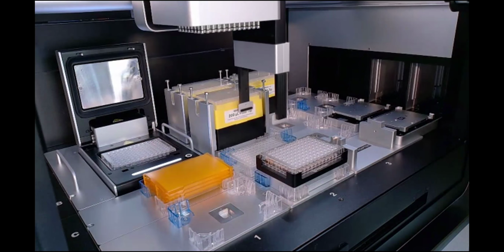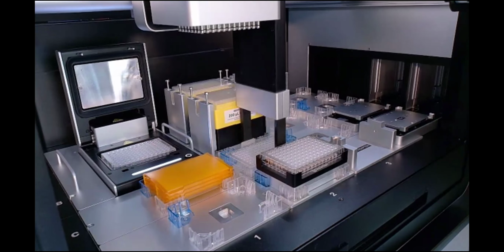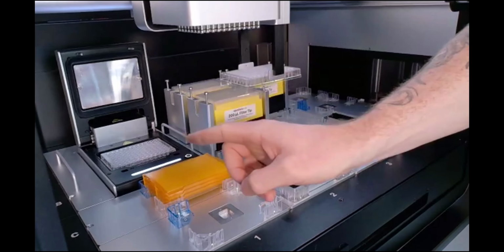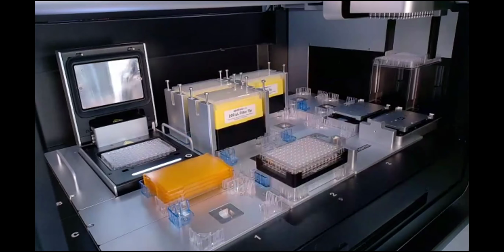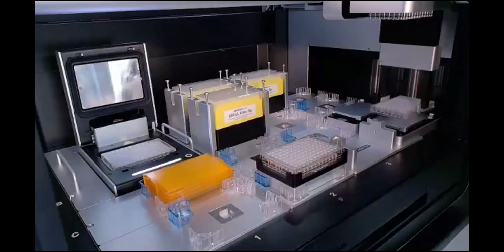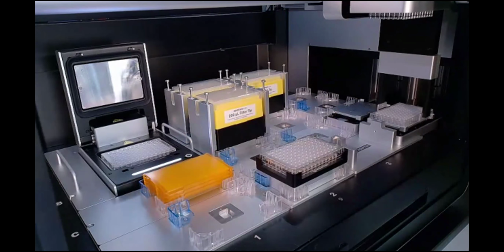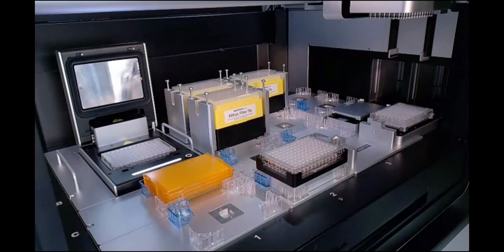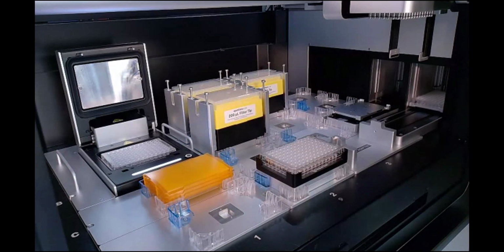Also, for anyone who is currently using our thermocycler, you will notice that the thermocycler that we are using here does not have one of the red seals, which are used to help seal off plates. Not only are they not necessary because we're using these auto sealing lids, but they do actually cause a source of interference in that pressing mechanism as you are doing this.